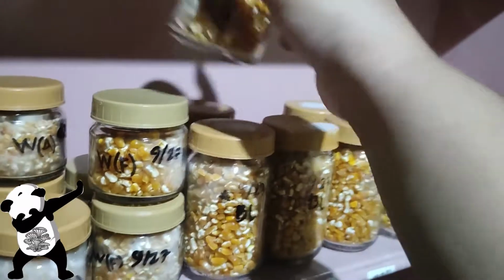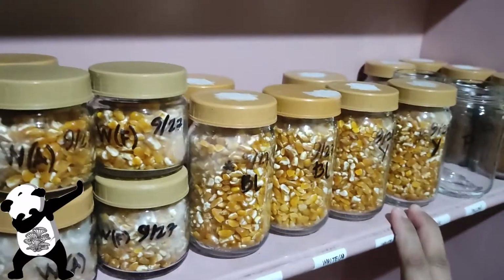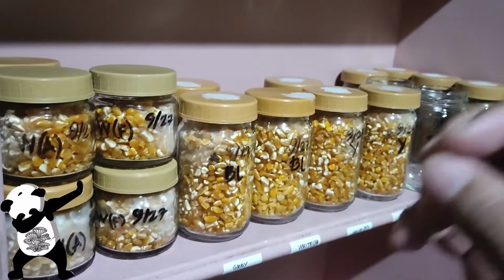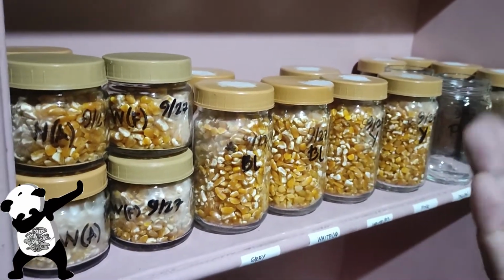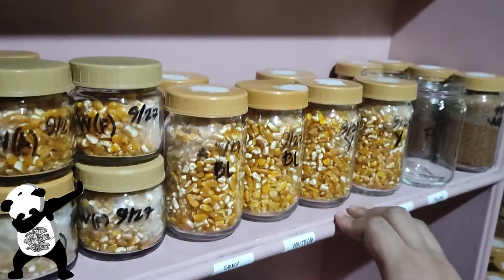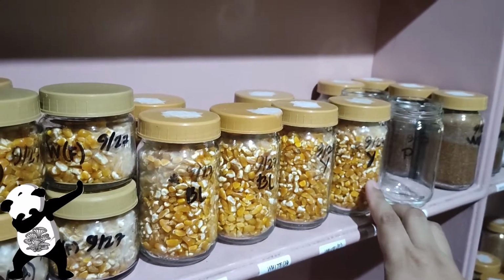You should familiarize yourself with the smell of mycelium. The black, the yellow, and the pink have different smells, even the white. But if you don't have any experience with those kinds of smell, if you smell sweet or sour, or pungent, it doesn't have to smell bad. If you smell things like that, that might be a sign of bacteria or contamination. But the yellow has a distinct smell, like citrus. So if you smell citrusy, it's actually normal.